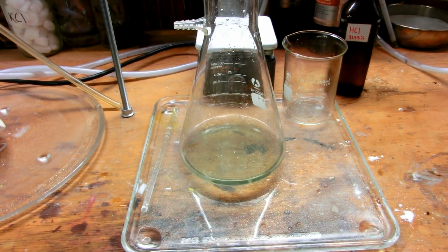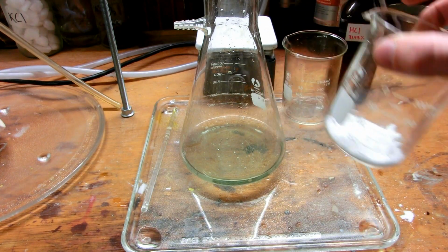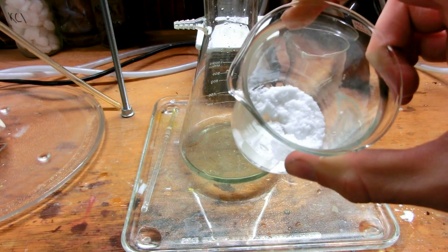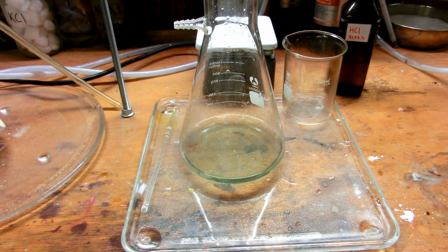And we also have here 10 grams of oxalic acid. And this is right around the stoichiometric amount. I did the math, and of course we have excess HCl. The whole thing is a little off of stoichiometry, but 10 grams of oxalic acid will do the trick. And this needs to be dissolved in water. So I'm going to go add some hot water to this.